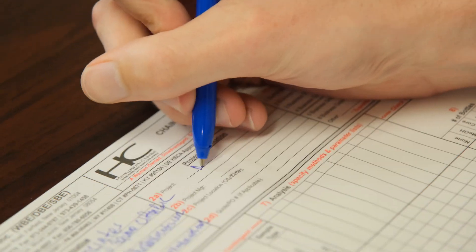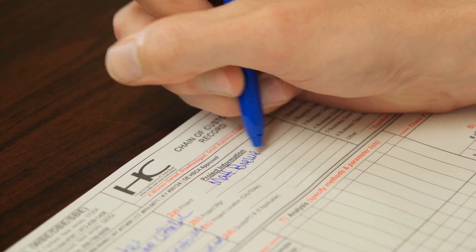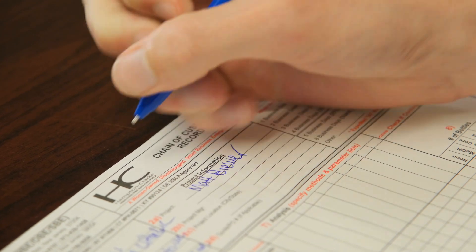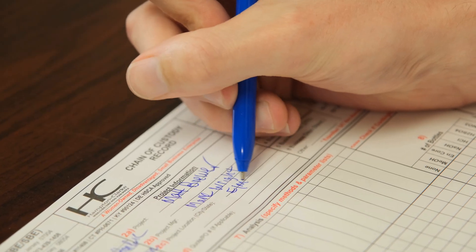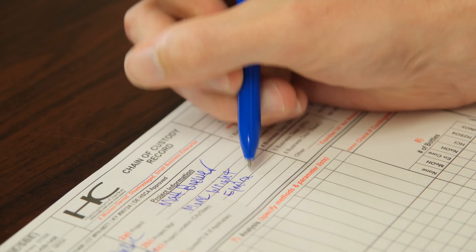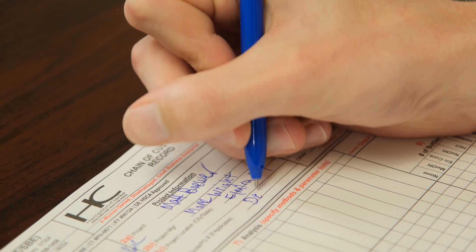Once you get that section done, you can move on to project-specific information. You always want to put down the title of wherever you might be. Project manager — same info. Project location could just be the city that you're in and the state. Quote or PO number is just a job number that you're billing all your time to. That's an easy section.